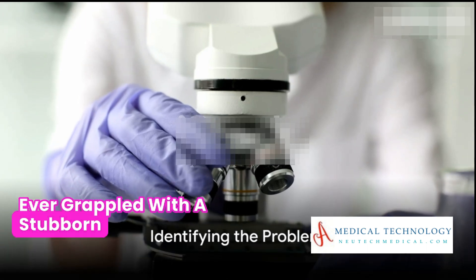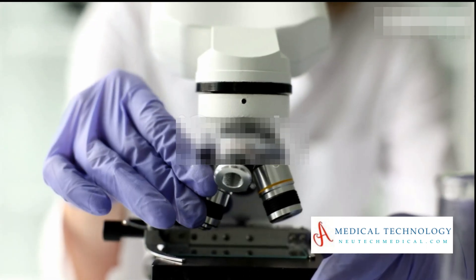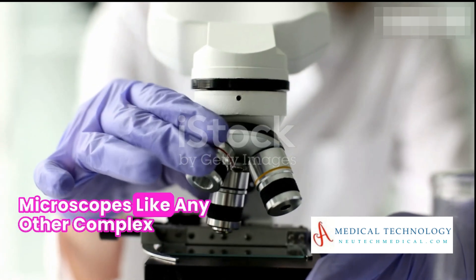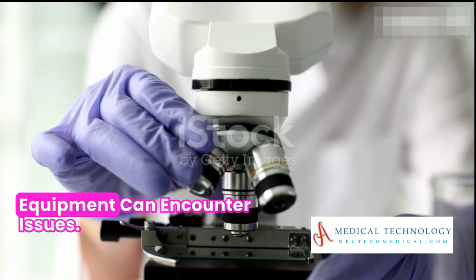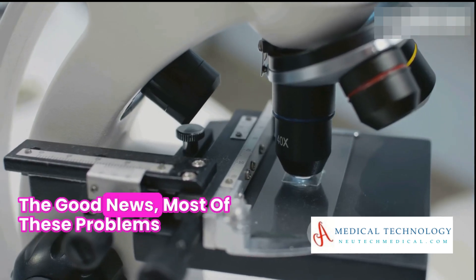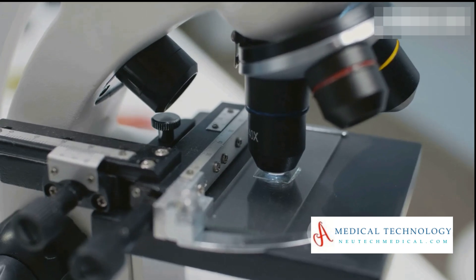Ever grappled with a stubborn microscope that just wouldn't cooperate? You're not alone. Microscopes, like any other complex equipment, can encounter issues. The good news? Most of these problems can be solved with a little troubleshooting.